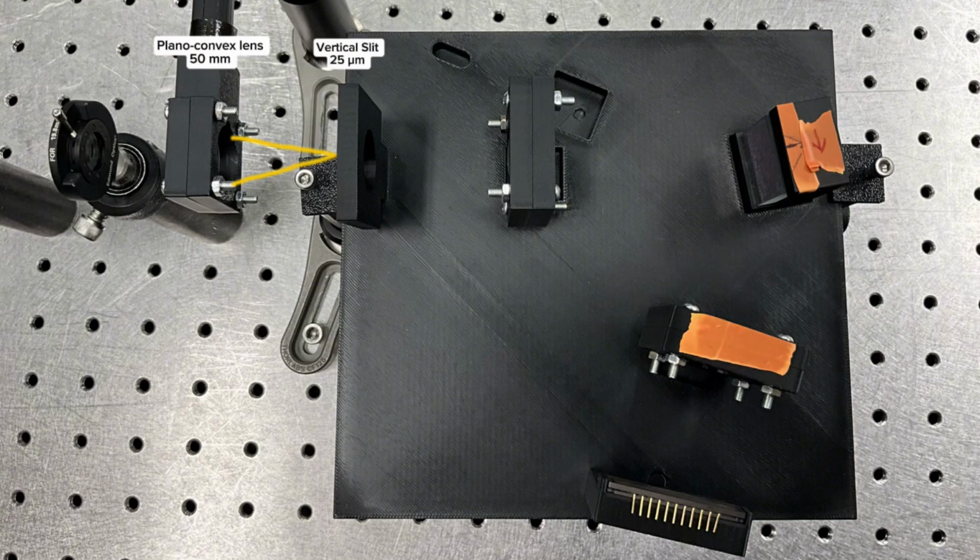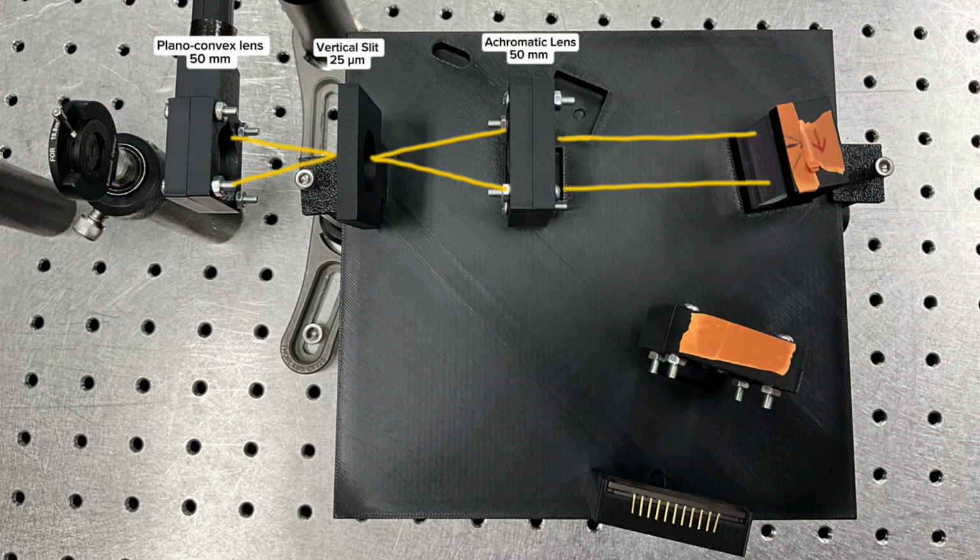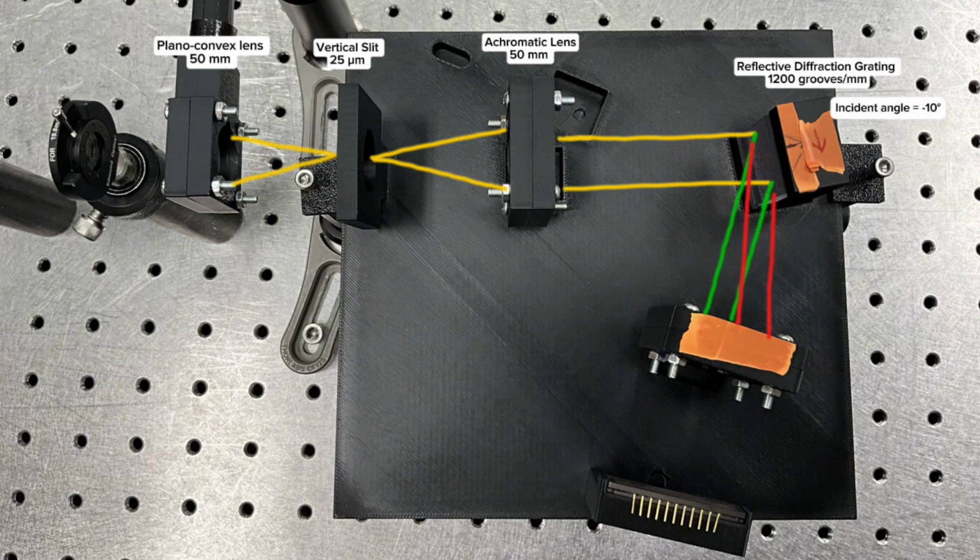The 25 micrometer vertical slit acts as a spatial filter and is the primary resolving element of the system. The light will diverge through the slit and be collimated by a 50mm achromatic lens. This collimated beam will then be incident onto a reflective diffraction grating with a groove density of 1200 grooves per millimeter. The diffraction grating will disperse the Raman signal, bending different wavelengths at distinct angles. This angular separation enables resolution of the individual wavelengths that correspond to the various vibrational modes of molecules within the fabric.